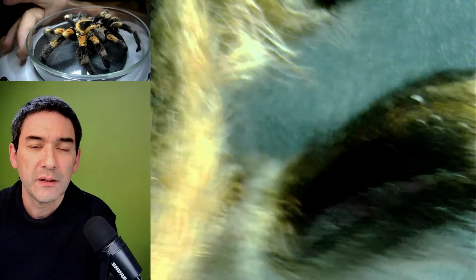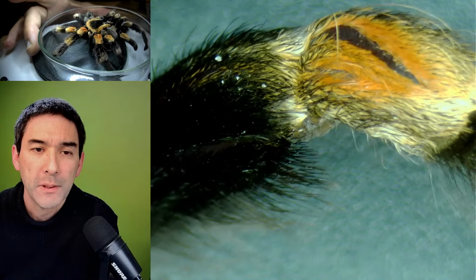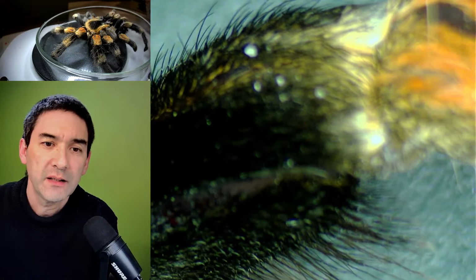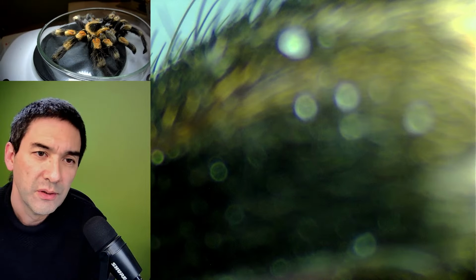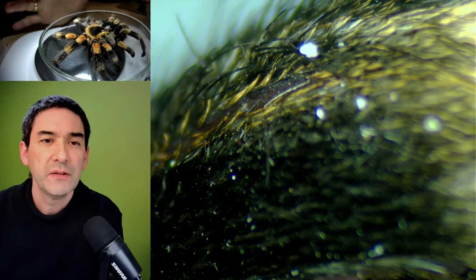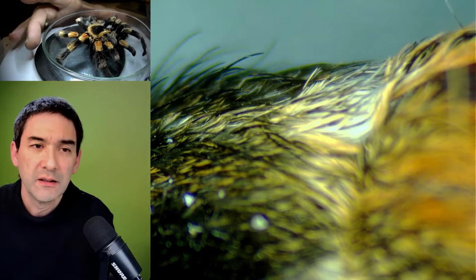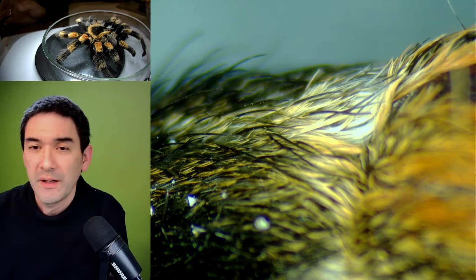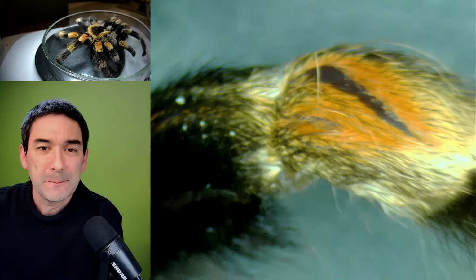This shows that the spider is kind of large. But when looking at this, despite the fact that it's not one of my favorite animals, I can still nevertheless not avoid the feeling of admiration. Look at the incredible complexity and all of those tiny little hairs. I think it's still in its own strange way a beautiful animal. So in that sense it's quite fascinating.